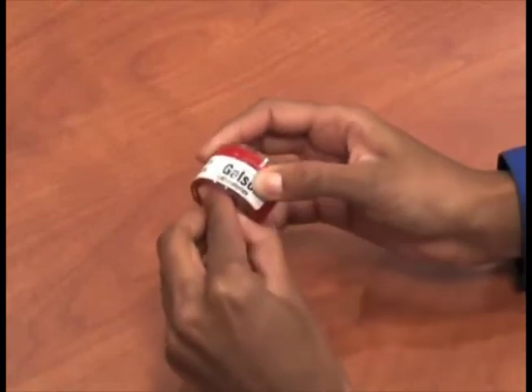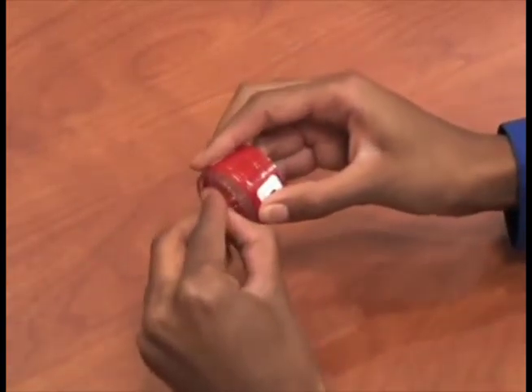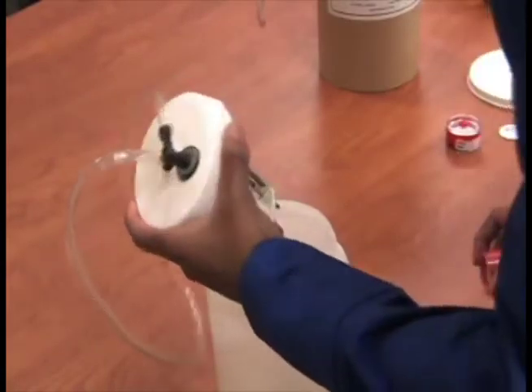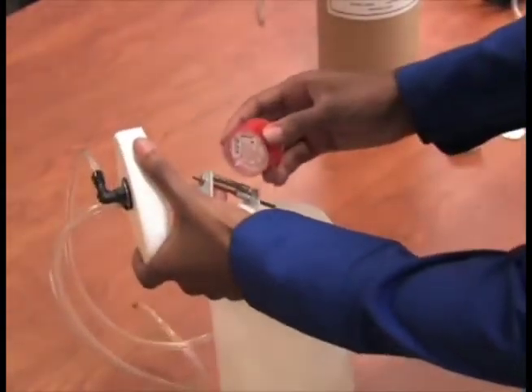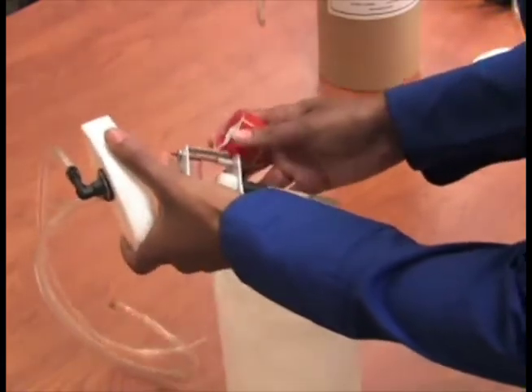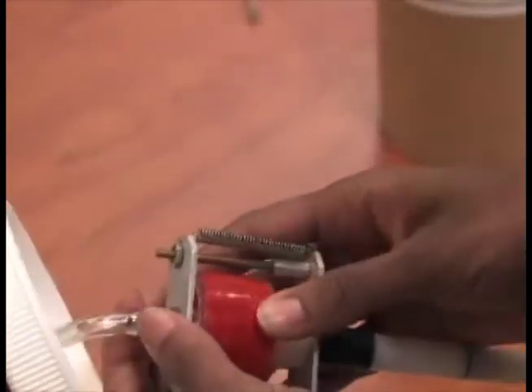To set up the Cyclone assembly for calibration, remove the colored nibs from each end of the cassette. Do not remove the threaded grit pot on the bottom of the Cyclone. Open the plastic calibration jar and insert a cassette into the bottom plate of the metal Cyclone holder, wagon wheel pattern up. Place the cassette in the Cyclone by extending the springs of the metal holder.